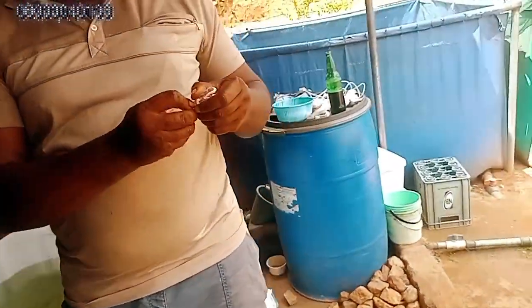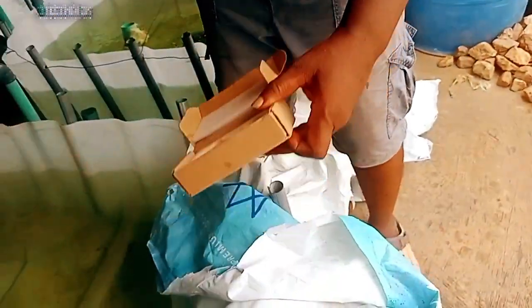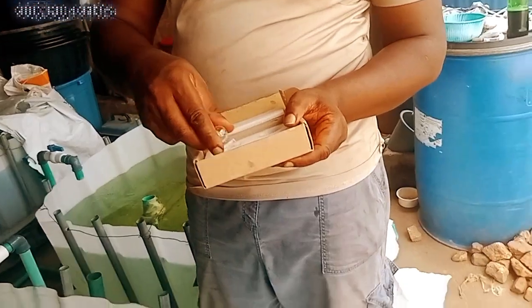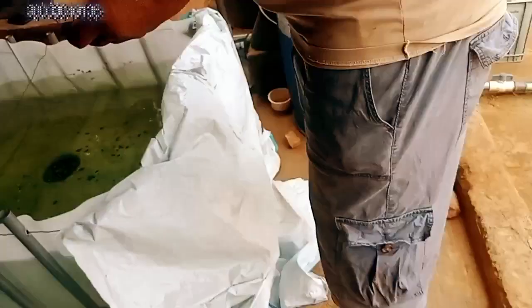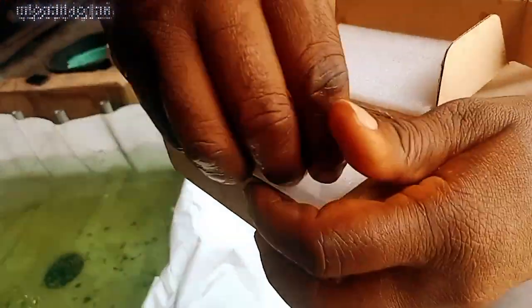Your checker comes with the bound to mount it with your pond, and it comes with a glass checker. So I will now put it back into the glass checker, as you can see, and this will be here.